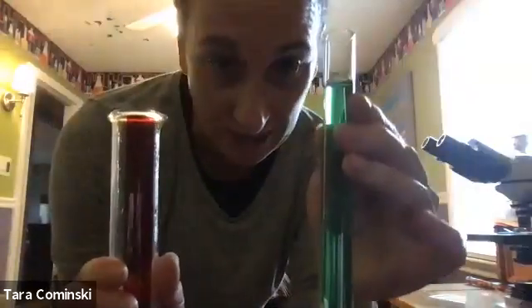And then it says, what is the test tube's total volume? So you're not gonna know that because I don't wanna tell you the answer of how you would do it. So don't worry about that. You'll leave that blank, all right? Just say how you would determine it though. Tell me how you would determine it. Here's your graduated cylinder, here's your test tube, and you got water, all right?